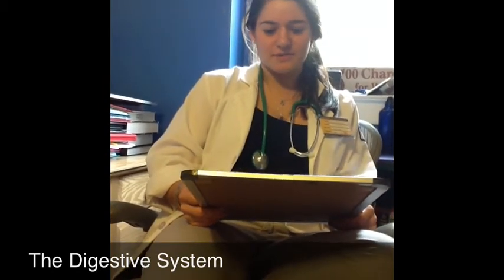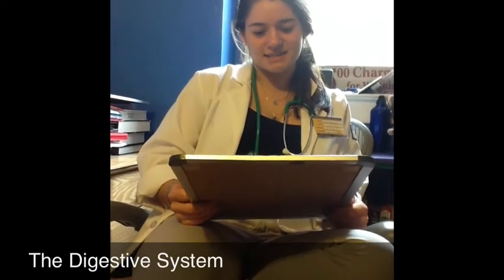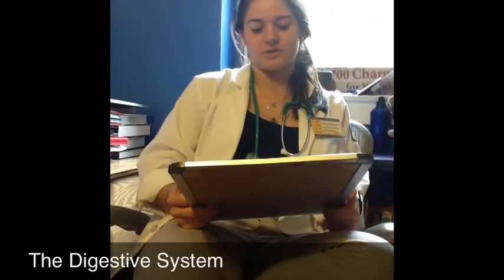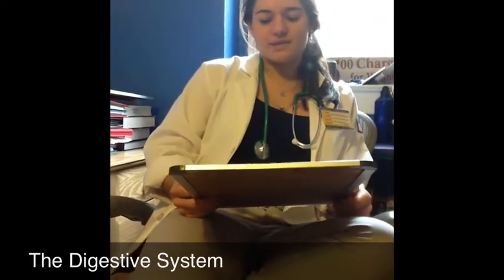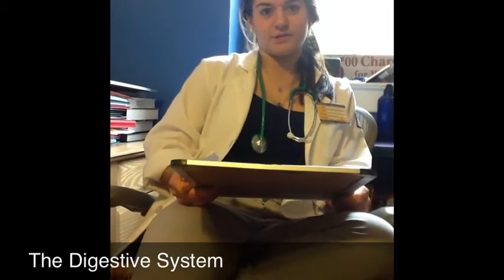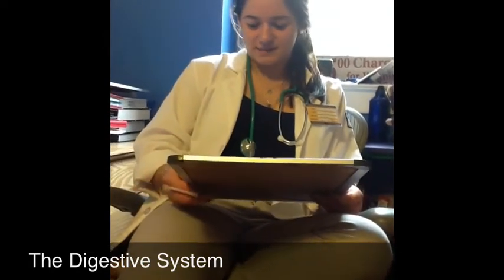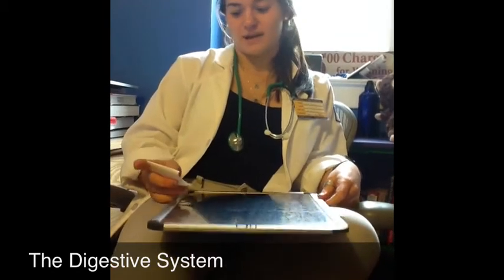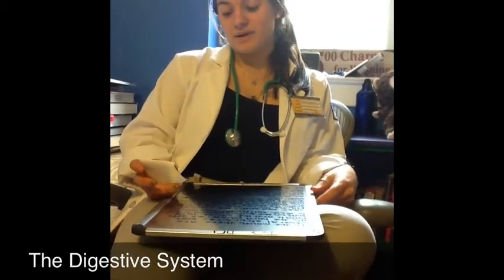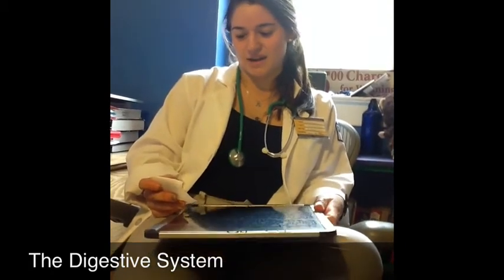When food enters the mouth of the pig, the incisor teeth help bite and gnaw. The canine teeth stab and tear, and the molars are used for crushing and grinding the food. The salivary glands produce saliva to break down the food, and are found in the lower jaw. At the base of the tongue, the oral cavity ends and the pharynx begins. The pharynx is the common passageway for food and air. The epiglottis is a flap that separates the windpipe from the esophagus, allowing food to travel to the stomach and air to travel to the lungs.